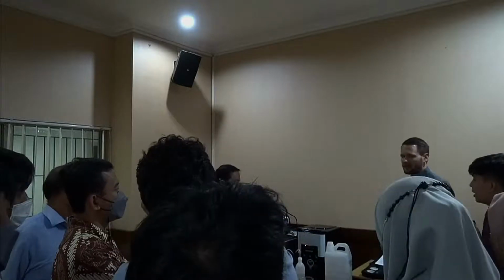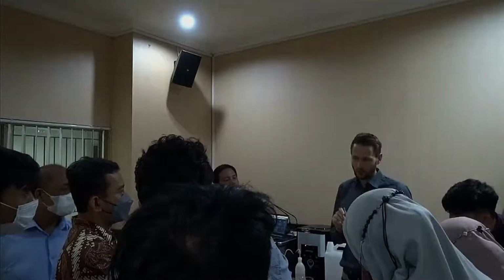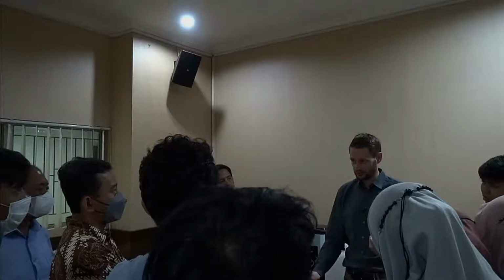I would never in real life use this first. This is the one we give you in the accessory suitcase. This is ultra strong. This is really, really strong. If you order a second dose of this, you made a mistake for sure, because you wasted. The procedure of using this is 1 drop on 20 milliliters of water, and from that solution, you can add a couple of drops in your dispersion. So as you can see, this should last very, very, very long.